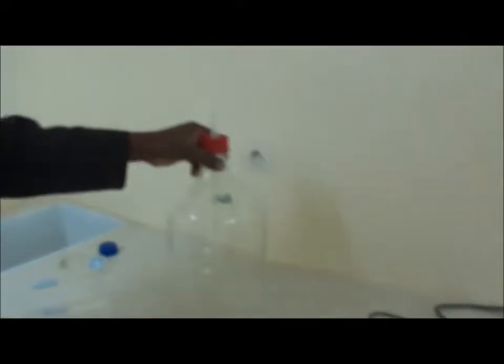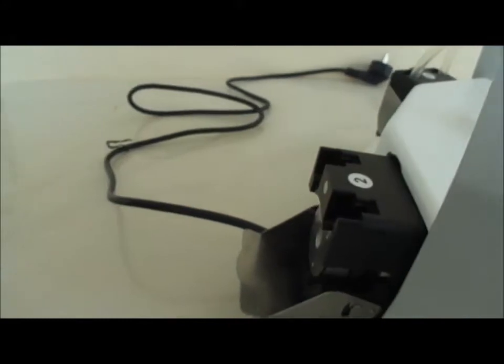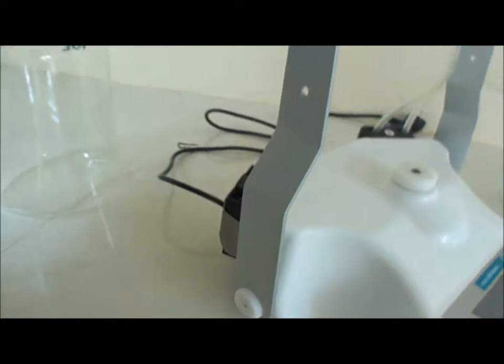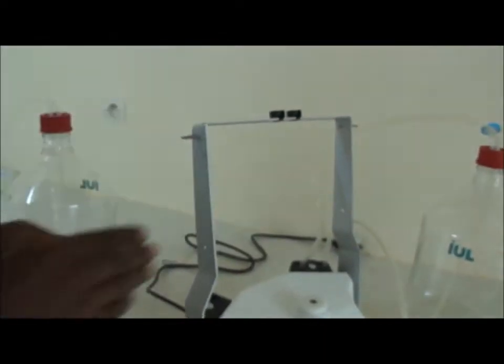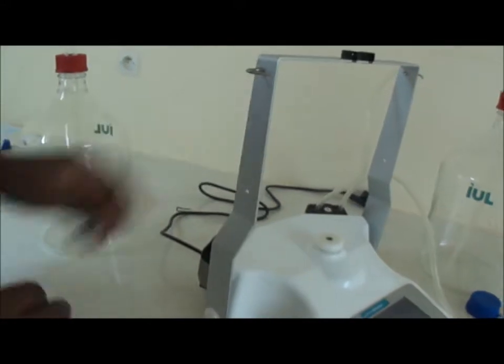We mount the second bottle, connecting the second bottle to the second pump the same way we have done the first bottle. You should remark that the frame has two extreme positions. This one is when it's on the back, this one is on the front.